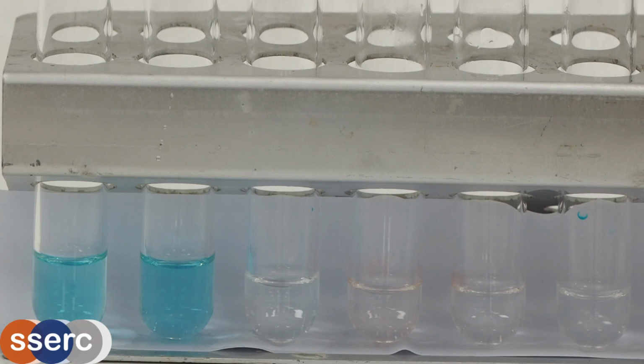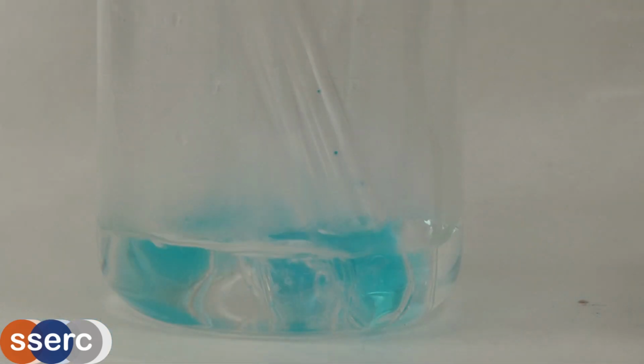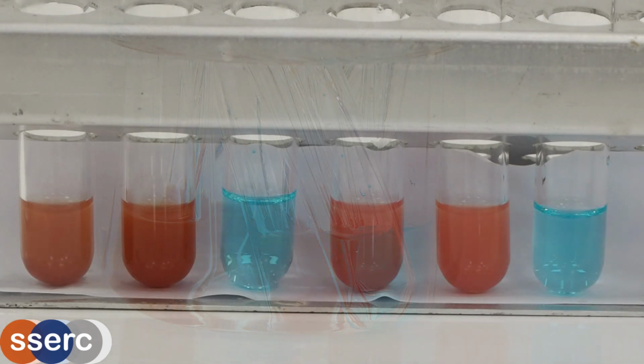A less common variant is Sandell's reagent. This is similar again to Fehling's, but is less alkaline, in that while still using sodium hydroxide, it is only 0.4 molar, and this time it uses EDTA as the complexing agent rather than citrate or tartrate. Once again though, the results are largely similar.